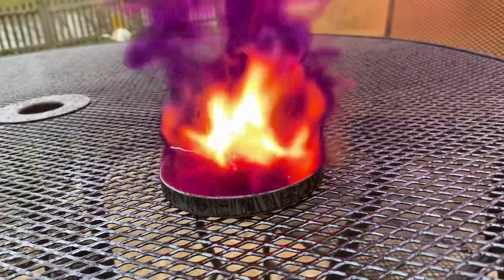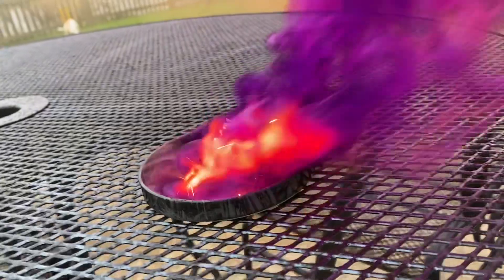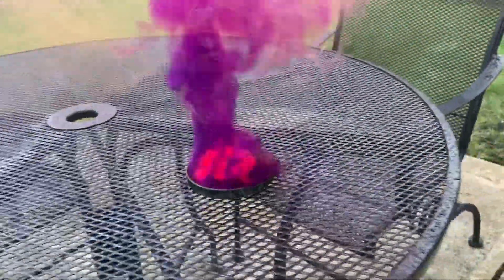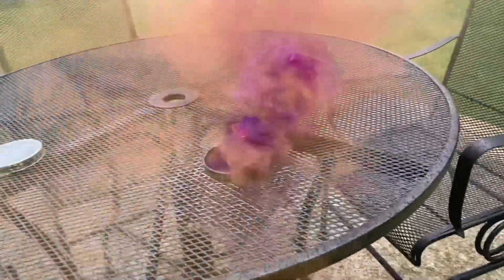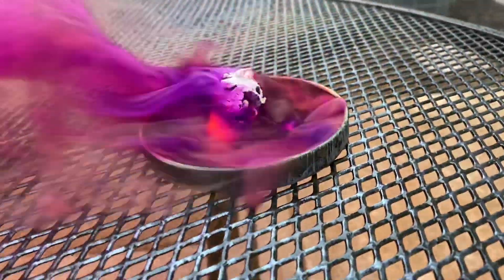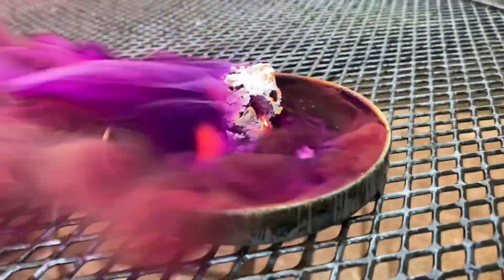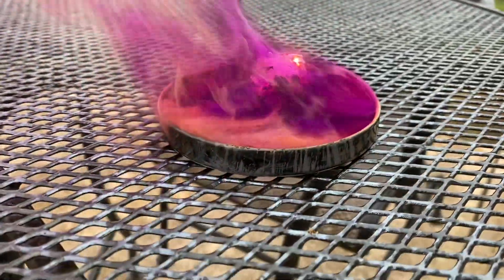Aluminum iodide in Ramsey Land. Just beautiful. Look at all that vapor. Wow, there it goes. This is what I saw. Thank you.